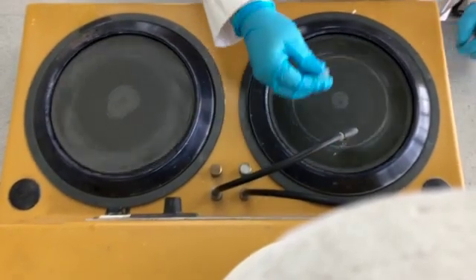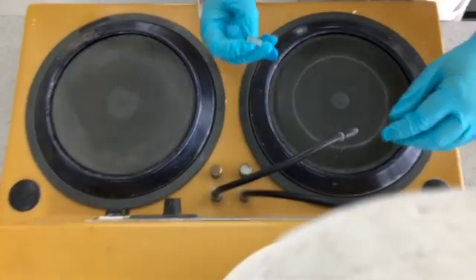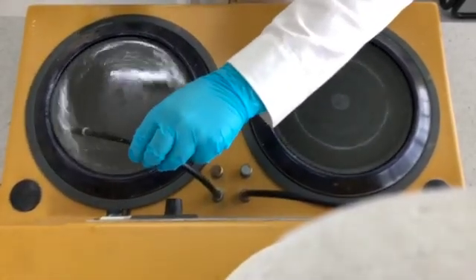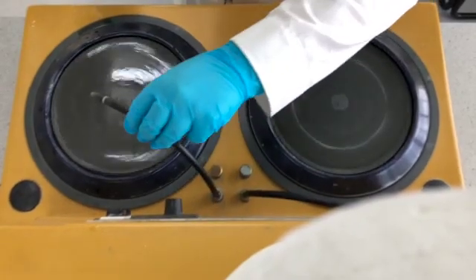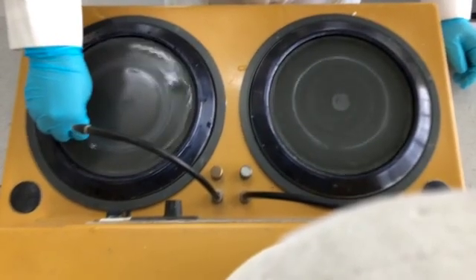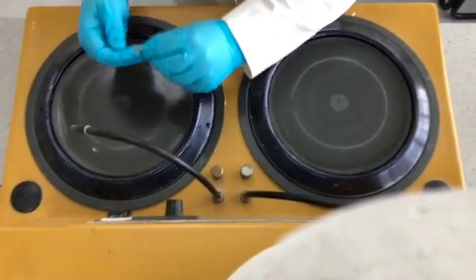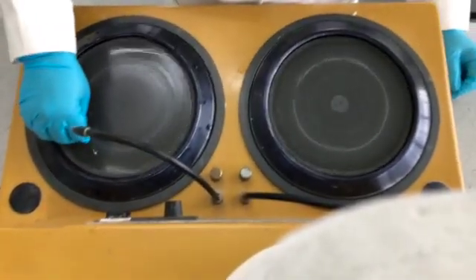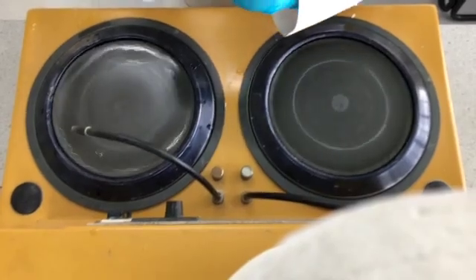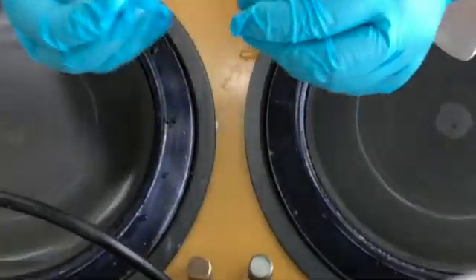It's also better to have a nice polished surface so that it makes it easier to see the layers and you're not seeing the striations from the grinder. So the second part is applying water to the polisher side to then polish down the surface to give us a nice flat surface, limiting the striations obtained from the grinder. You can see I just keep checking what the surface looks like to make sure that the polished surface is adequate for subsequent cross section analysis and microscopy.